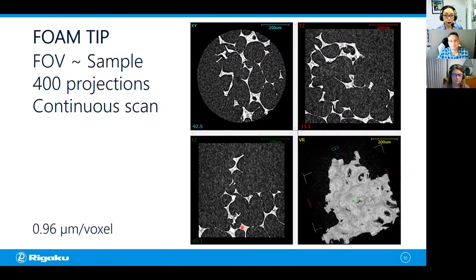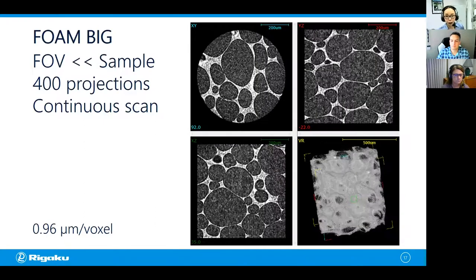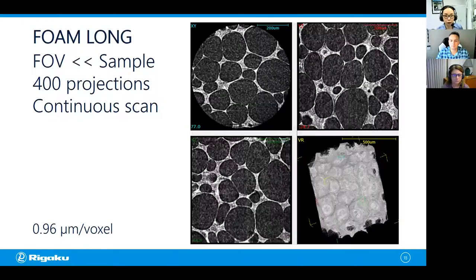So in this case, you want the sample to be a little bit bigger than the field of view so that you will scan the intact center part. Now, if you make the sample a little bit bigger, you're going to scan like this. This is bigger than the field of view, but not long, kind of a chubby sample. This one looks pretty good. I don't see any streaks and you don't see any damage from the sample sectioning. So this looks pretty good. And if you do a long one, like the one we just did, you might or you might not see those streaks coming from the sample movement.